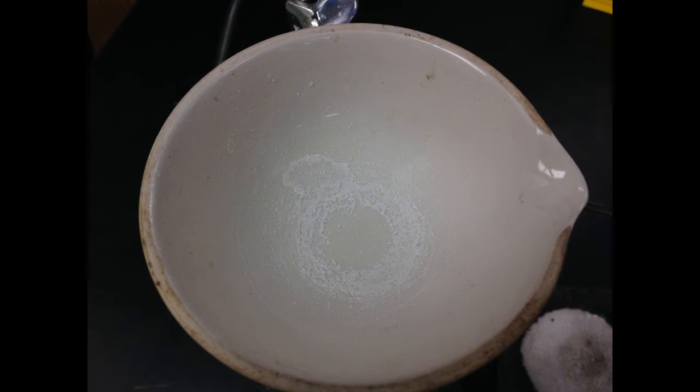And finally, I will leave you with a picture of the inside of the evaporating dish, but this has been Arman Rashid, and as always, have a pleasant day.